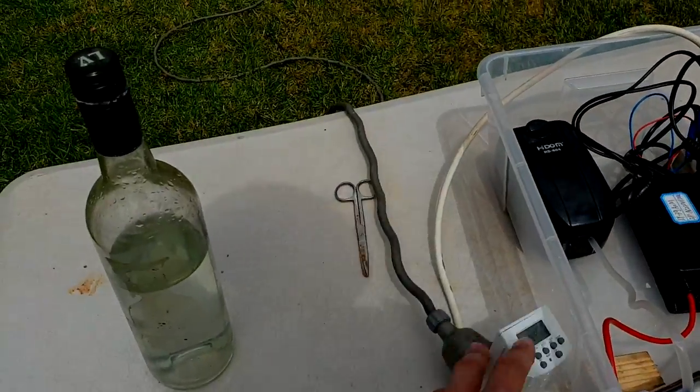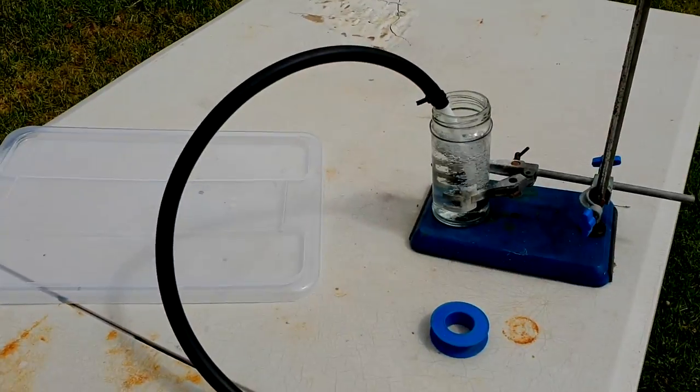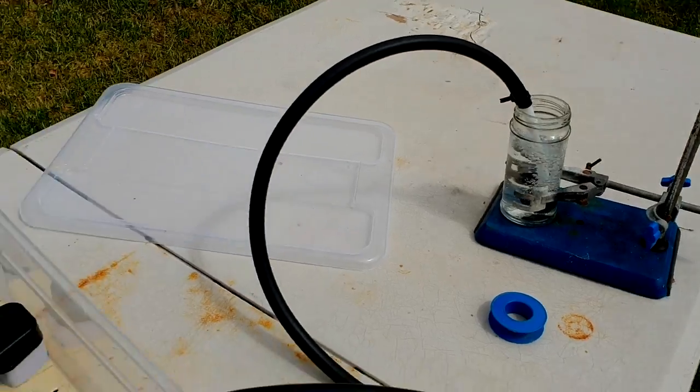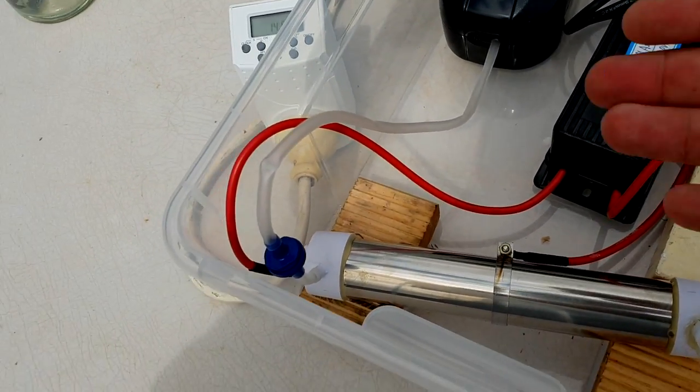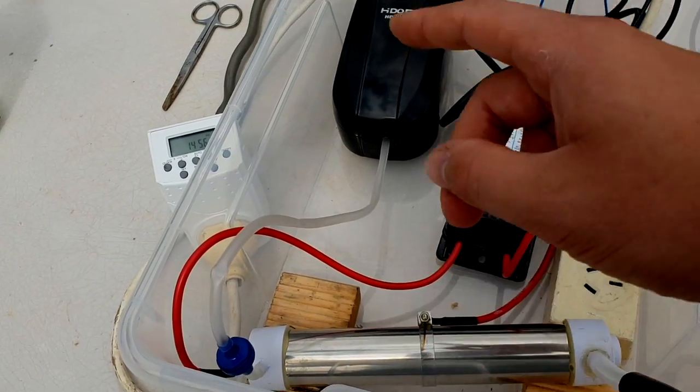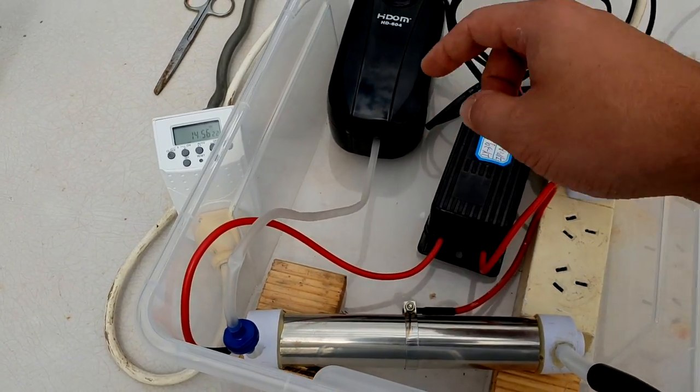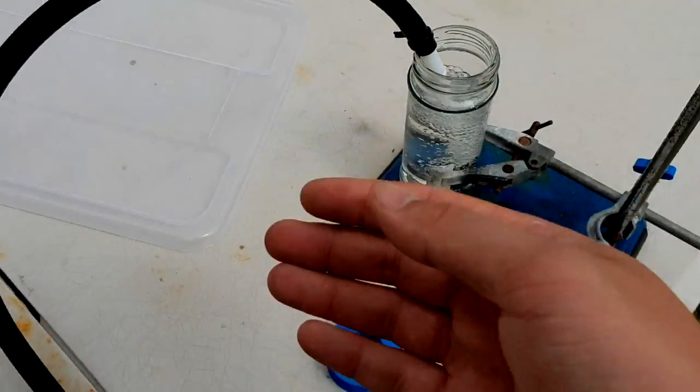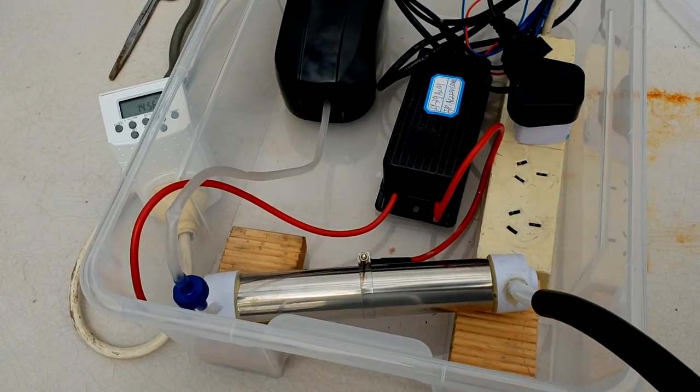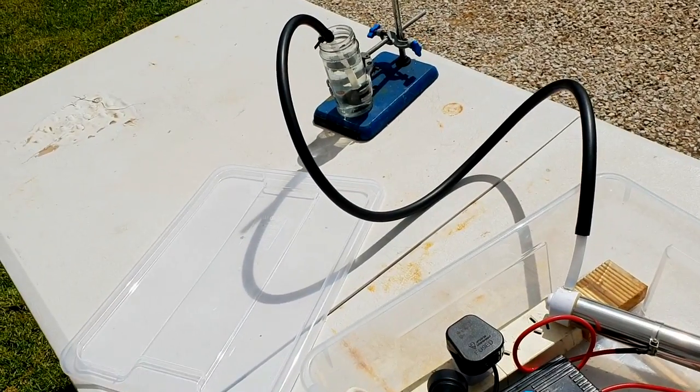So what I've got here is I've got my big bottle of ammonia, and we're going to be putting in probably 200 mils, 250 mils into there. I've also installed a one-way valve here. That was the one-way valve that came with the pump. So when the pump turns off, none of the ozone can go back through here and into the pump because that will shorten the pump's lifetime. All right, there's 150 mils in there, so let's flick it on, see what happens.